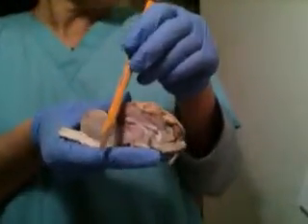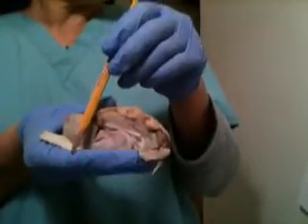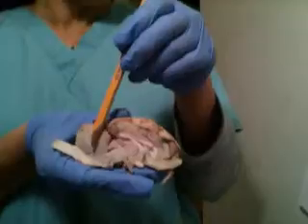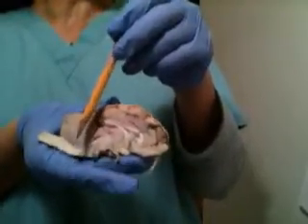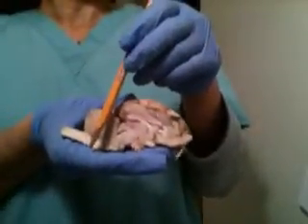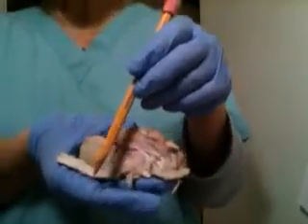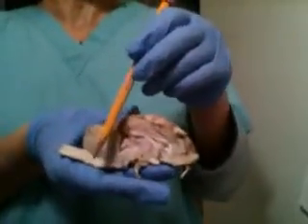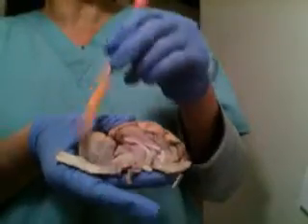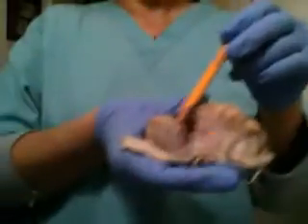This area, cerebellum, and arbor vitae is the white matter inside the cerebellum, and it means tree of life in Latin, because of the tree-like appearance it has, and this white matter brings sensory and motor information to and from the cerebellum.